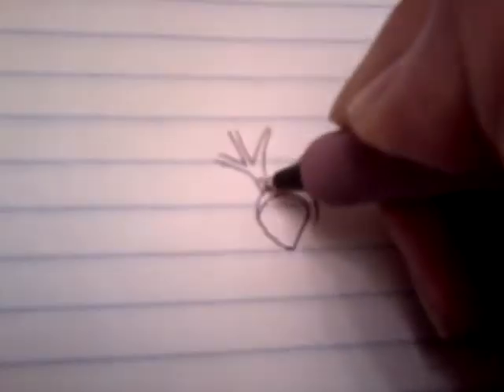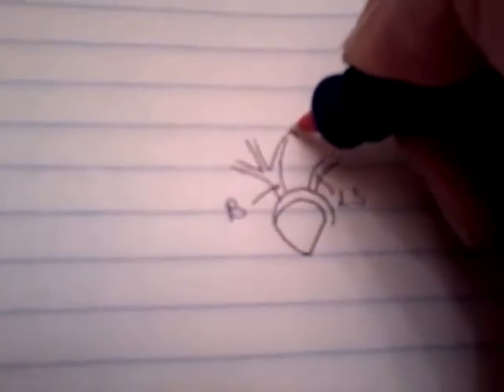This here, before the branching occurs, is the brachiocephalic artery. We use red to show that they're all arteries and not veins. So this leads towards the head, and this one is parallel to this one, and we have the 3rd branch that goes out laterally like so.